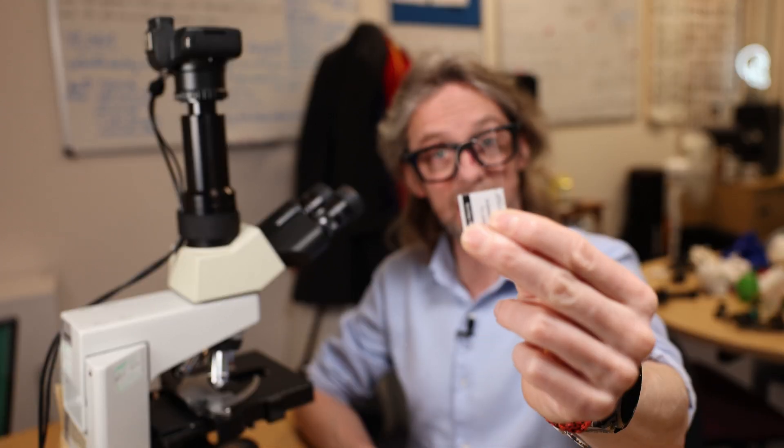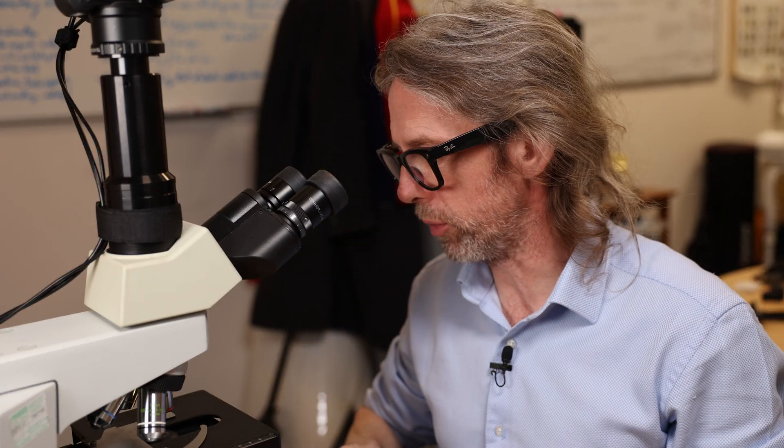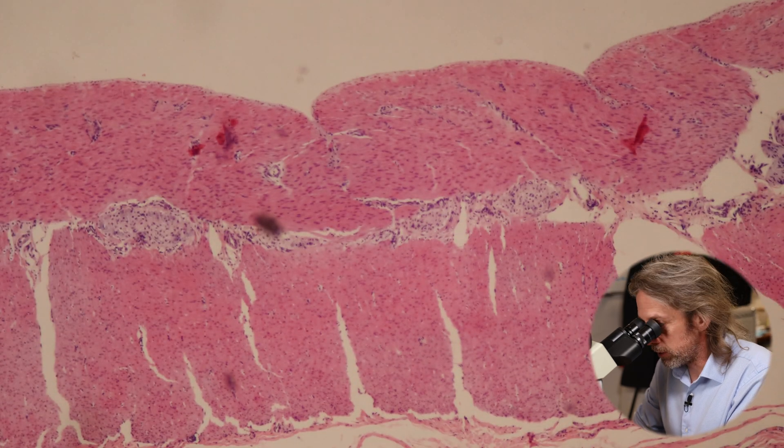Let's look at the large bowel. This is some colon - the large bowel has a very muscular wall with two layers: an inner circular layer running around the tube and an outer longitudinal layer. That is how food is propelled along the tube, so this is a good tissue to look at for smooth muscle, found all the way along the gastrointestinal tract.